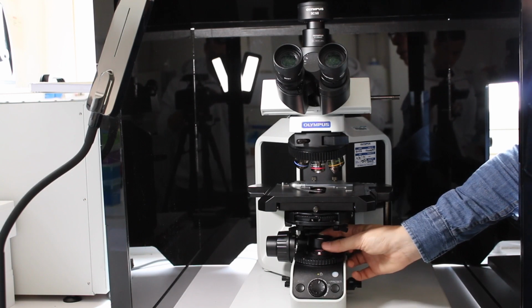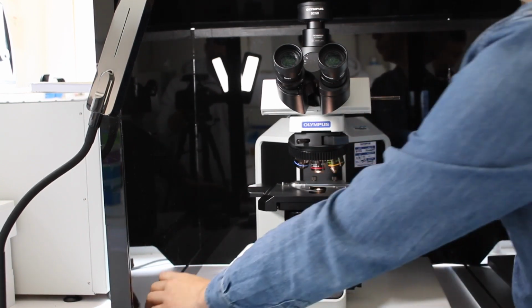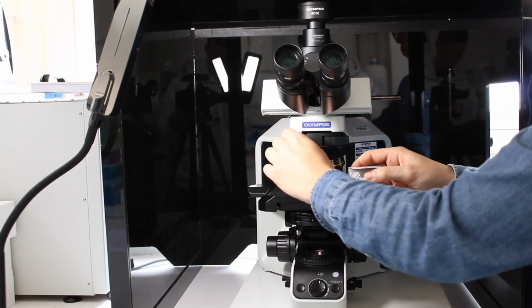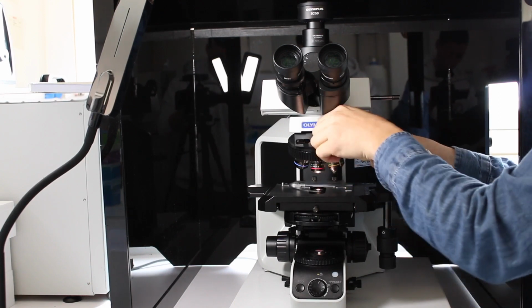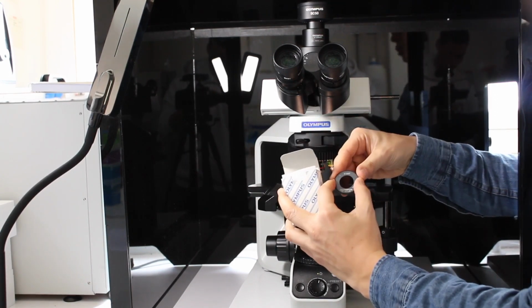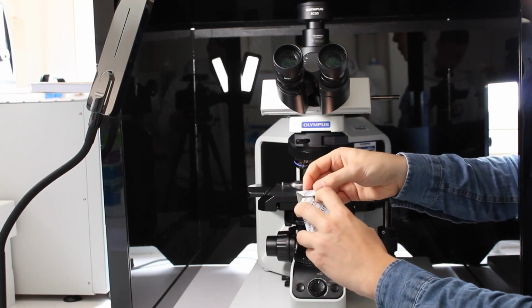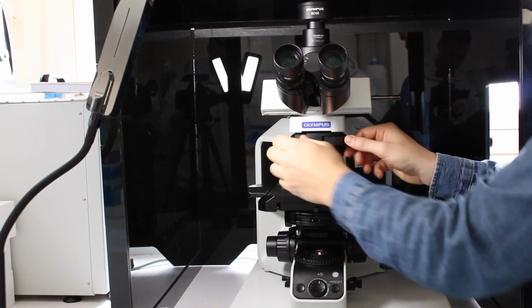Once you're done using the two parts, you should put them back where they were to avoid having any dust on them. So you would remove that and put it back in this box. And the other one, of course, make sure that you're not touching these filters with your fingers. Be careful, take them by the edge and put them back in the box, leave the box again on the side, and screw back the case as it was in place.